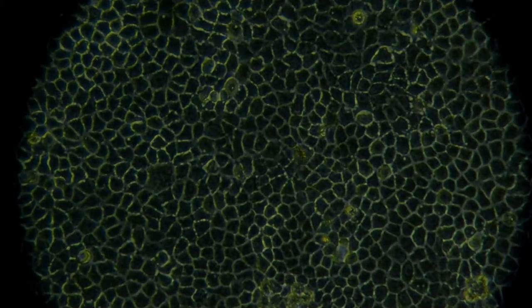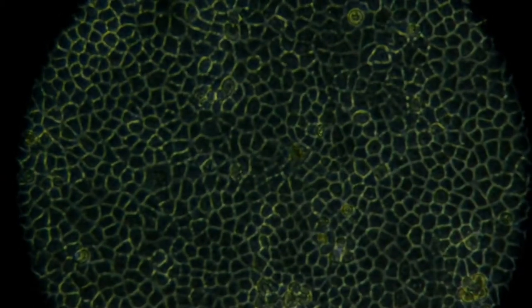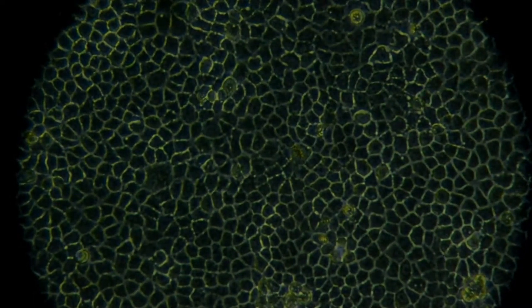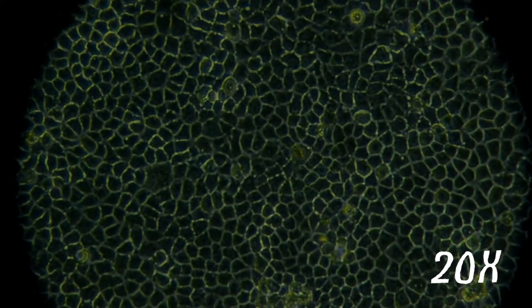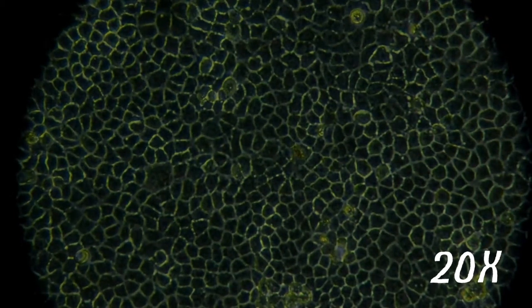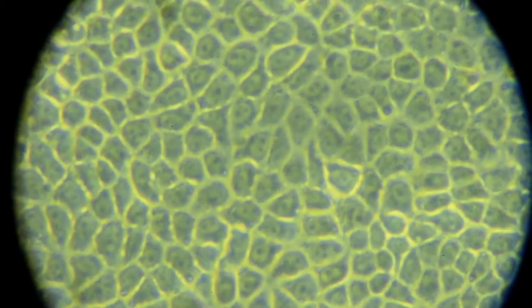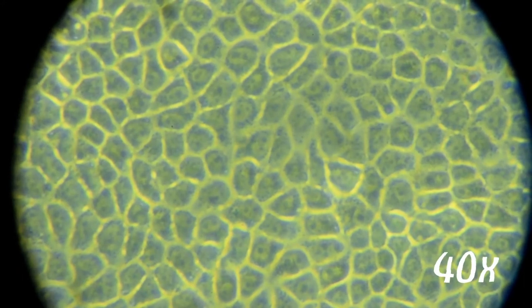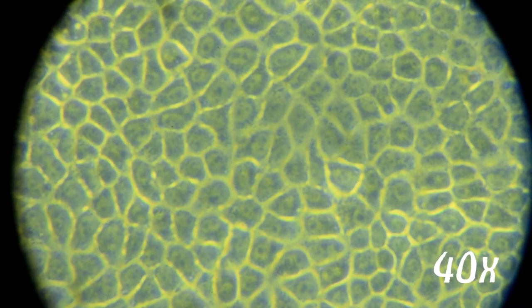At 20x magnification, you can see bright lines which are the boundaries shared by neighboring cells. That is how these particular cells grow. The highest magnification on this microscope is 40x — let's go there now. At 40x you can see structures that are 40 times the actual size of the cells.